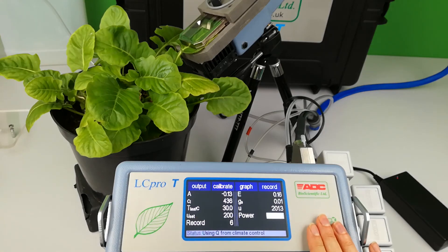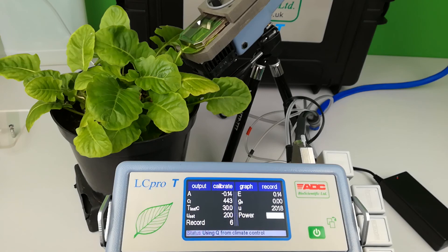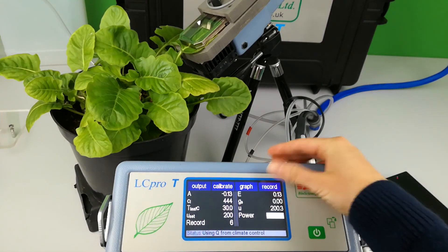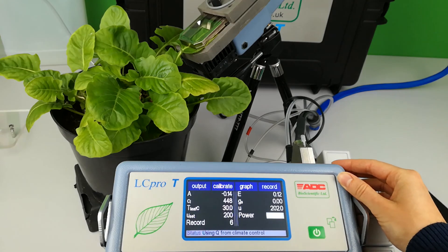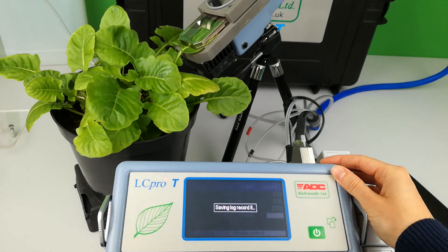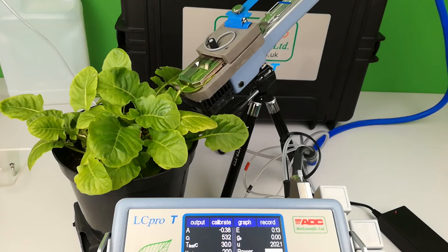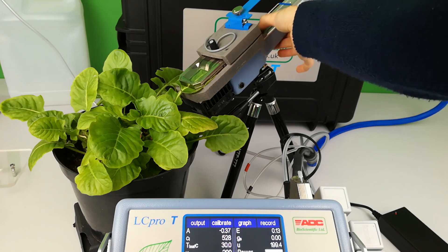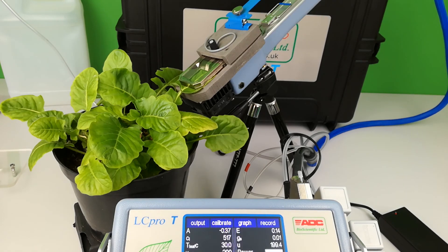Once values are stable, a record or data point may be taken via the touch screen using the record button on the top right. A message will alert that a log has been saved to the live data logging file. Alternatively, use the small black record button on the chamber handle just below the thumb latch.